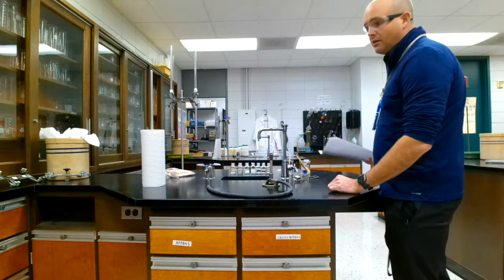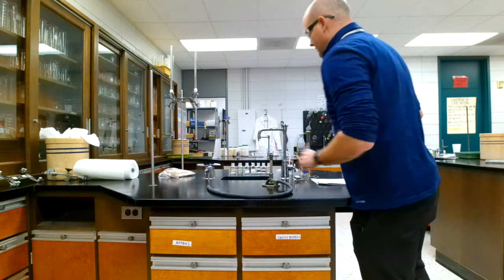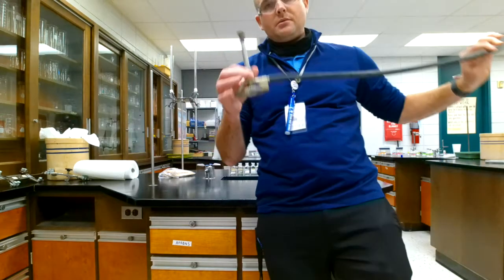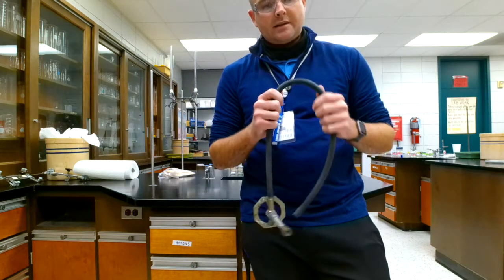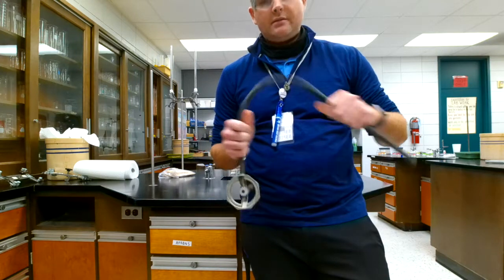So I'll make sure that all flammable objects are a foot away, and just make sure we're going to move stuff as far away as possible. And then I need to secure my equipment. So there are parts to a Bunsen burner that we need to check out. There's the hose, right? So we're going to look at the hose, make sure there's no cracks in it, and it's all squared away. If there are cracks, we'll take it out of service.